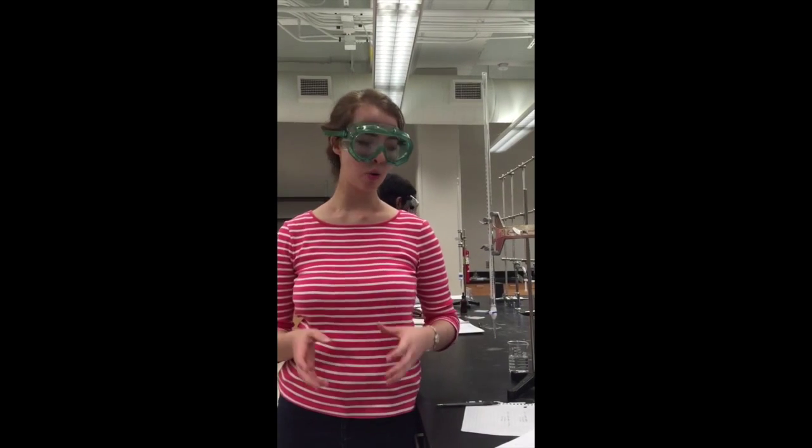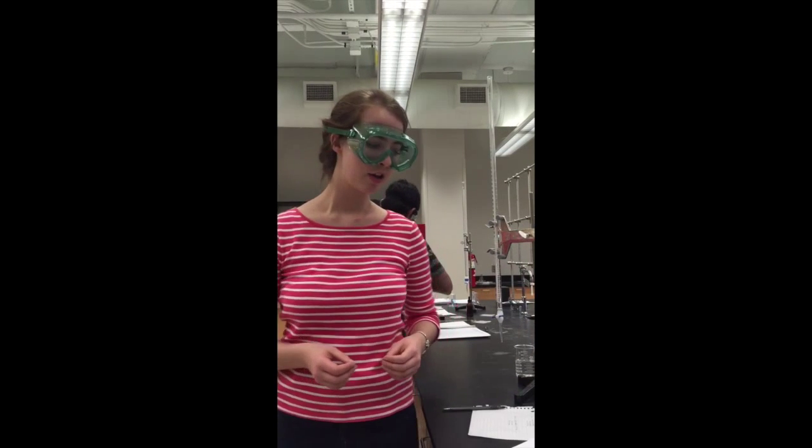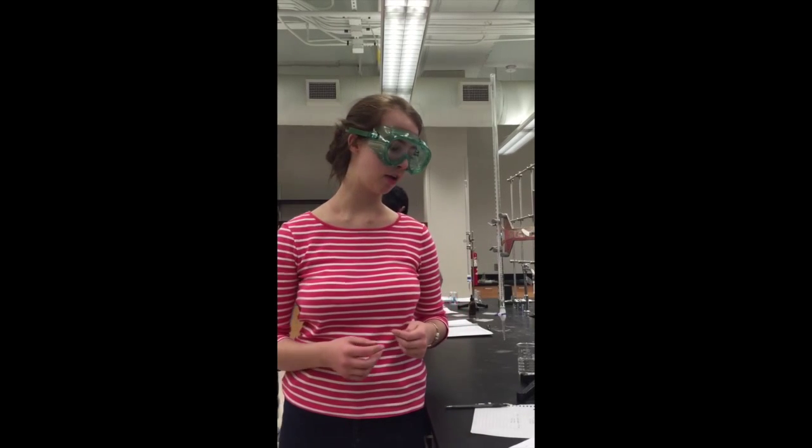Titrations are also used to determine the stoichiometry of a reaction, the number of electrons gained or accepted in a redox reaction, or solubility products. So before you begin a titration, there are three things that you need to know. You need to know the concentration of your standard solution, and you also need to know the initial volumes of your analyte and standard solutions.